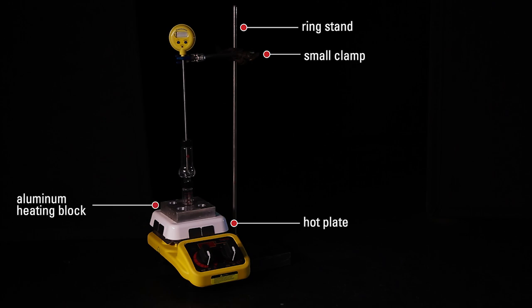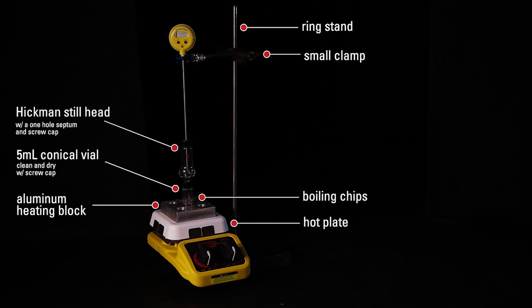an aluminum heating block, a clean and dry 5 milliliter conical vial with screw cap, boiling chips, a Hickman stillhead with a one hole septum and screw cap, and a digital thermometer.